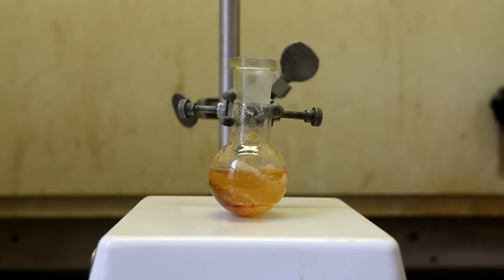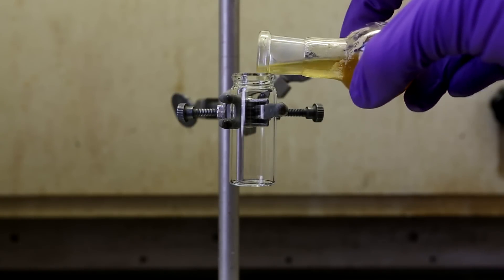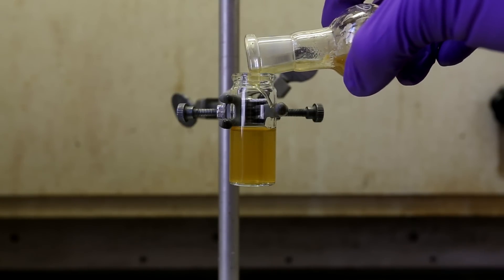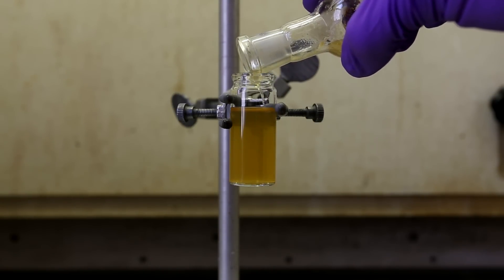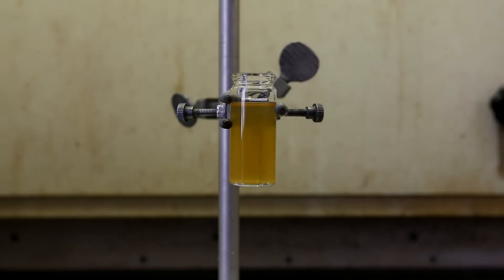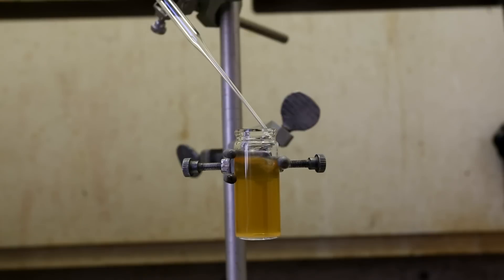I then let the solution sit for about 30 minutes so that the particulate could settle to the bottom. I used ethanol because cadaverine is significantly more soluble in ethanol than lysine or sodium bicarbonate. I then transferred the solution to a small dram vial and unfortunately you can see that the solution still contains quite a bit of particulate.